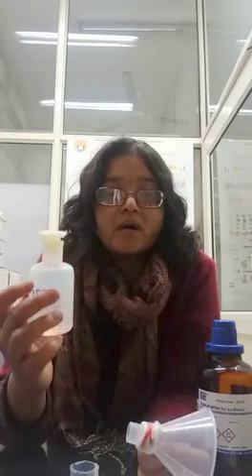The idea is to put a few drops of ether — that is good enough to anesthetize the flies for about four to five minutes. You don't need a lot of it, because if you put too many drops it will kill the flies as well. So just a few drops is good enough.